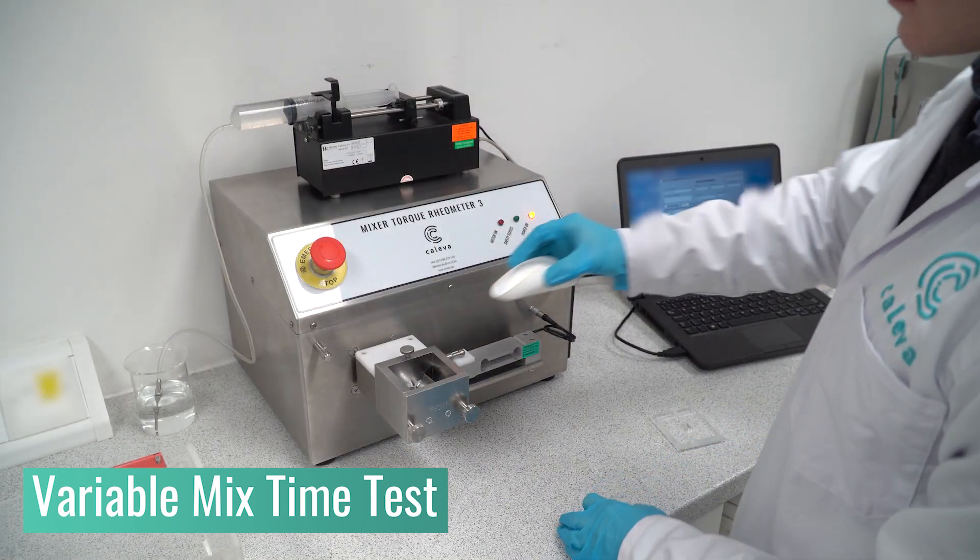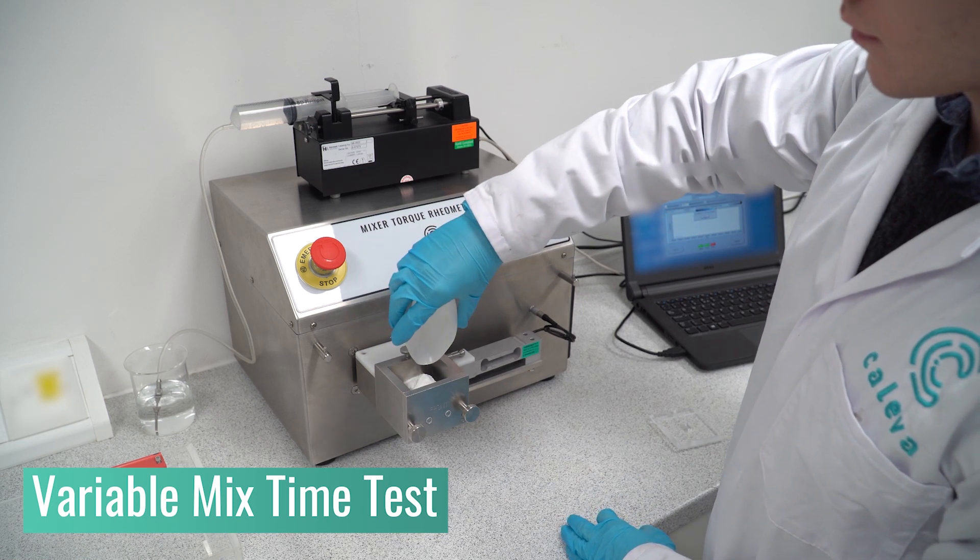With a fresh sample of material inside of the mixer bowl, and the syringe refilled, the second test can begin.